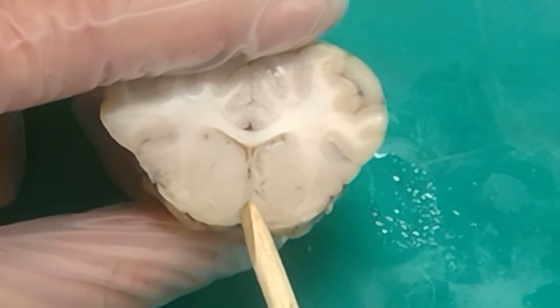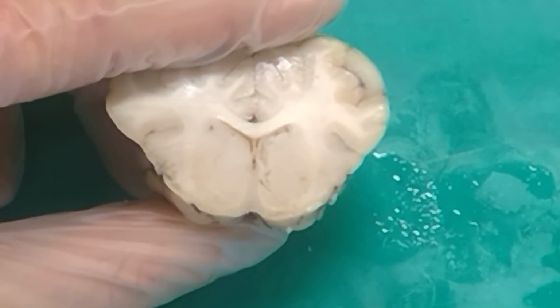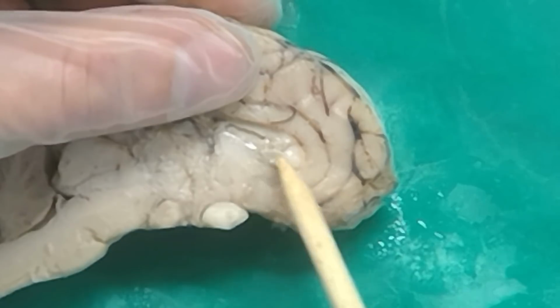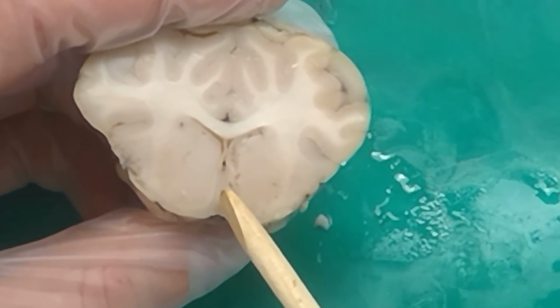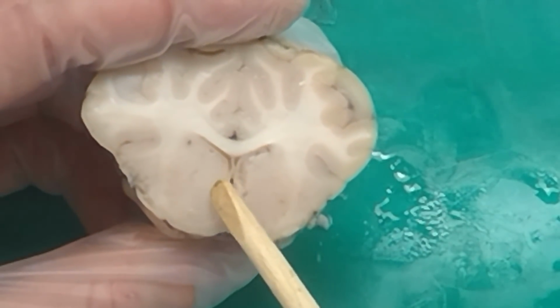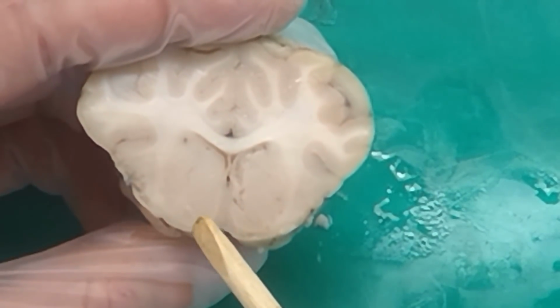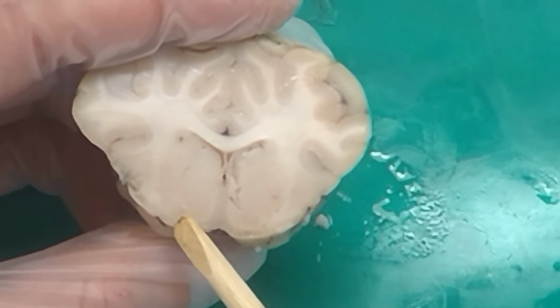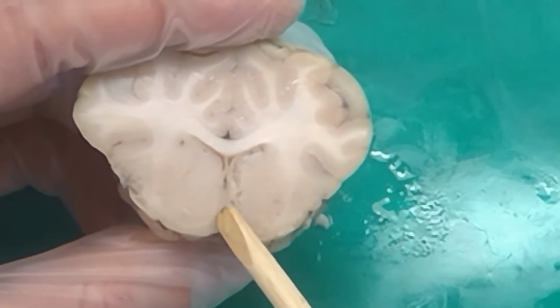Is it kind of obvious because the septum is only in the front? So here is the septum. It's this area right here that's below the front of the corpus callosum. You can kind of tell on there, but I think on here it becomes really clear where you can see this tissue right here. You've got a white line that's separating the caudate from the septum. There is no white line separating the septum from the anterior perforated substance. You can see clearly it just keeps following along right there. You've got a white line that's outlining the caudate all the way here. You have no white line splitting the anterior perforated substance from the septum.